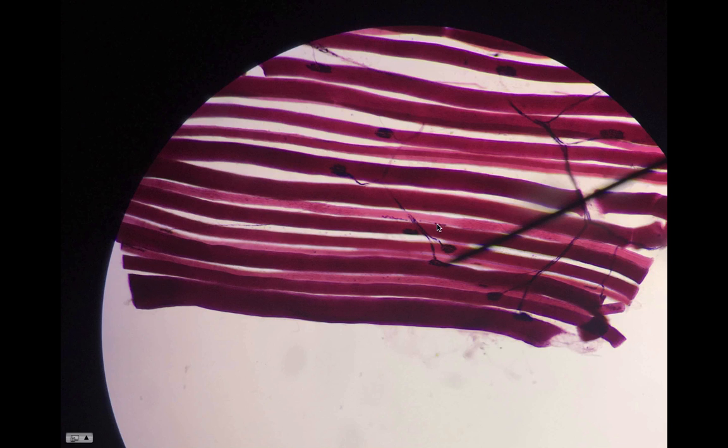Here is a slide from our class. Victoria took this also. Here are the muscle fibers. This is a longitudinal section. Correcto mundo? Yes. This white stuff in between the muscle fibers is what? Endomysium. These lines are what? These are axons that are coming from our motor neurons.